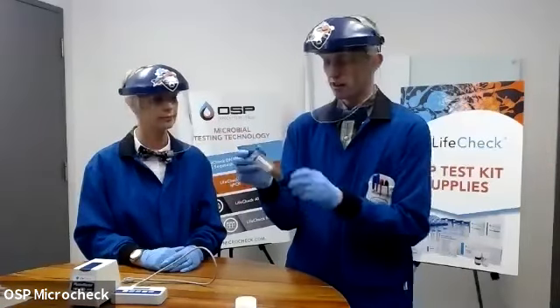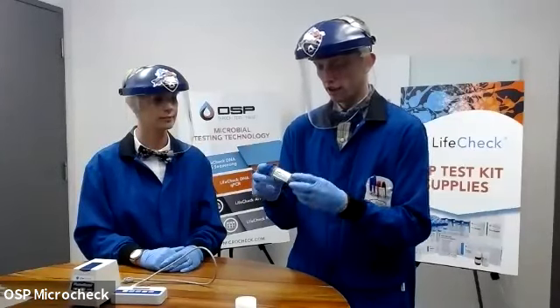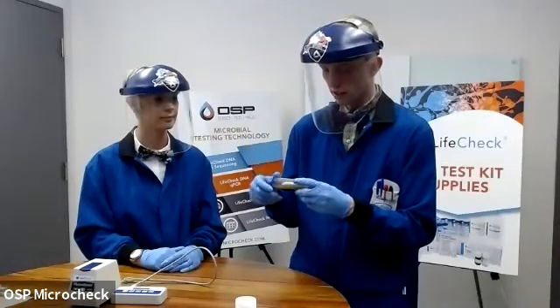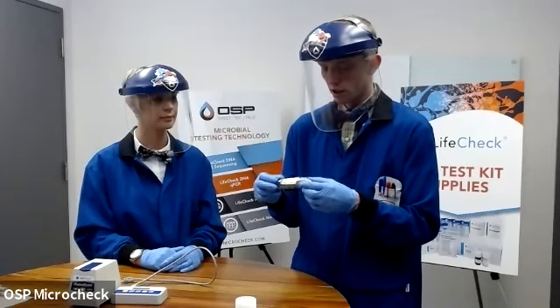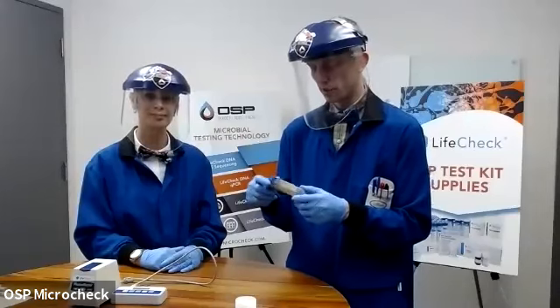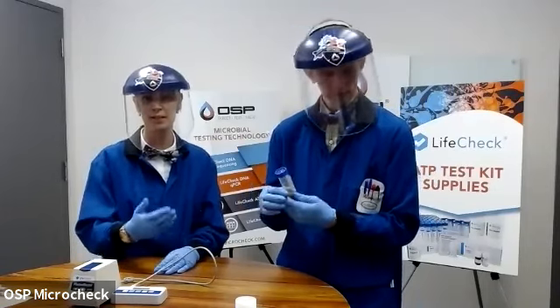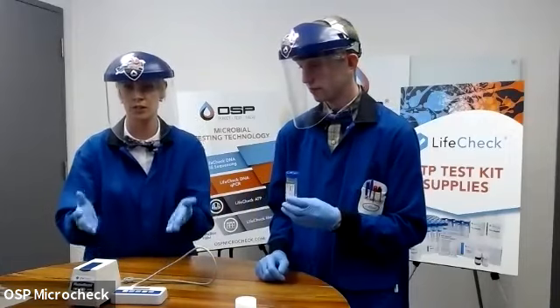So at this point, now that I've introduced my sample to my reagent X, I'm just going to gently rock it around. If this was a sample with a lot of oil organics, you'd see that oil starting to coat all of the plastic. And the concept here is really just trying to have your reagent X contact as much of your sample as possible. You're going to do this for 10 minutes. And that's it. And then you go into the next step, which you take your sample out of that and go into your interpretation or your results.